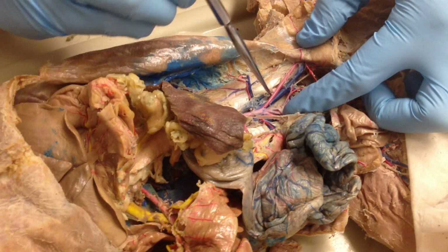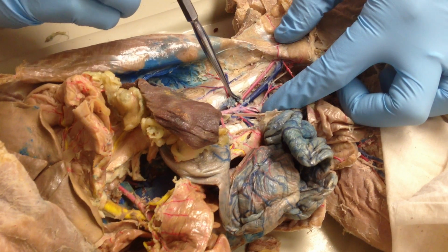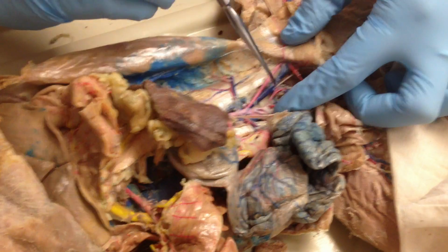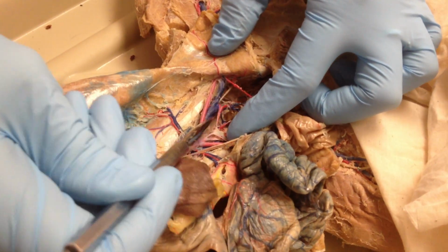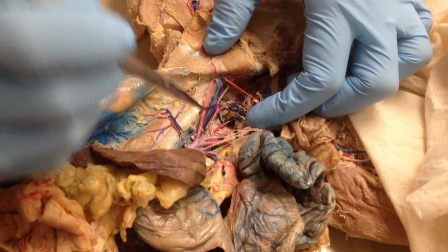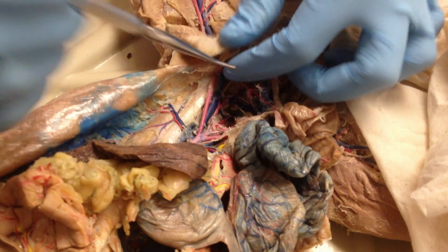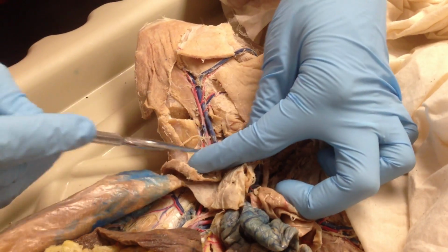That's different from the vein. The vein starts as common iliac, not as external iliac. And the switch from common iliac to external, you have to find the internal iliac first. So this branch down into here, that's the internal iliac for the vein. So it's not parallel the way the artery is. It's a branch. So that's internal iliac. Once you found internal iliac, then you've got external iliac. Both of them come onto the leg, and that's the femoral artery and vein.